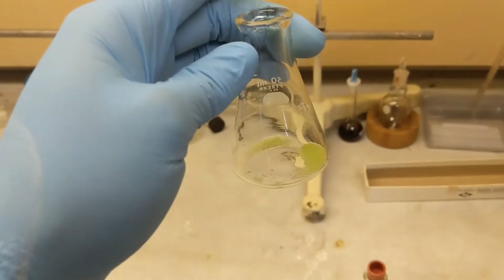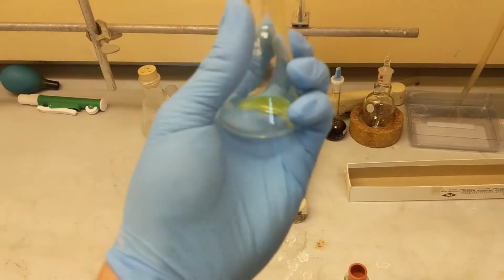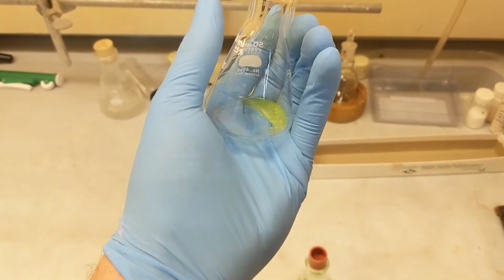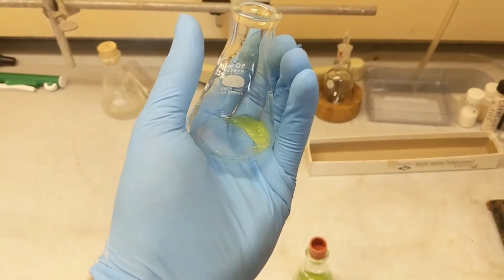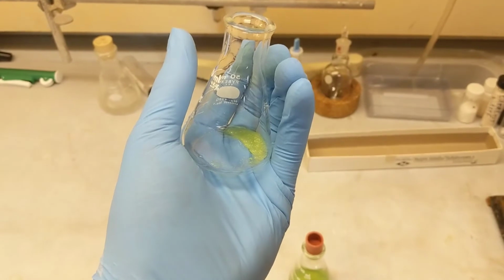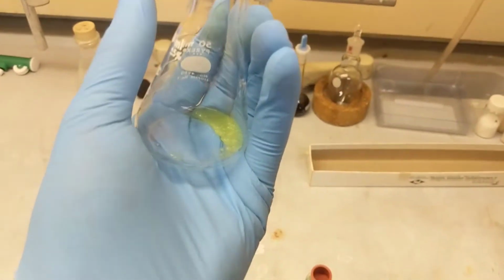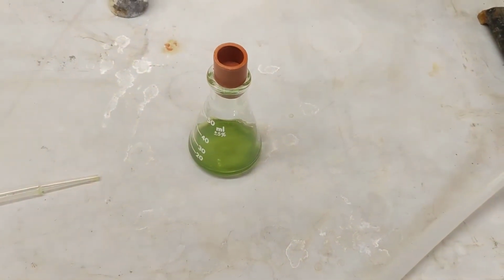Oh my goodness, I'm sorry. Can you see now? What if I do it like a beauty guru? Yeah, there we go. You can see there's probably some I can get out, but I really don't want sodium sulfate in this. It's really important I don't, so I'd rather have that type of error than have sodium sulfate in my sample.